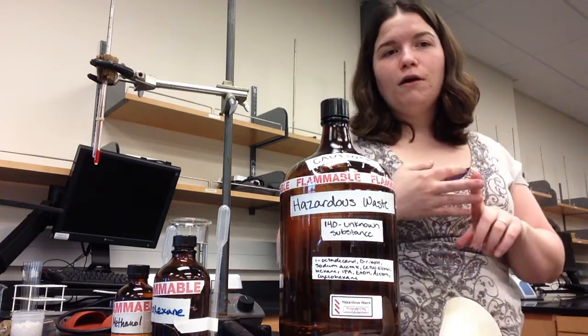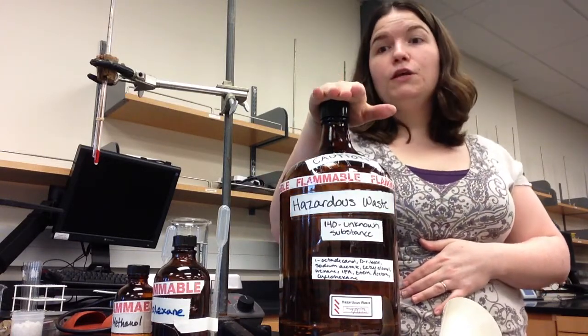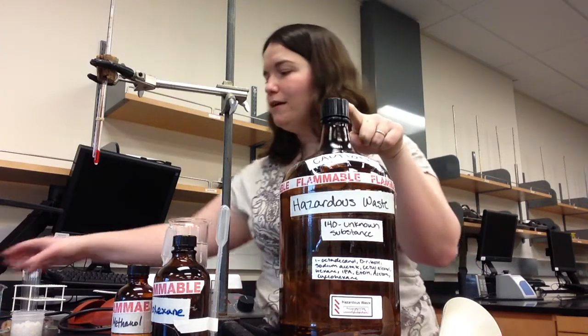So we're going to put our unknown liquid, any extra solvents, our unknown solid, all into this container. Just one container for this lab. You can then wash things out in the sink, and you can pour the water from your hot beaker down the drain into the sink also. The capillary tubes should not go into the hazardous waste. Instead, there will be a beaker labeled waste in the fume hood for you to put the capillary tubes.